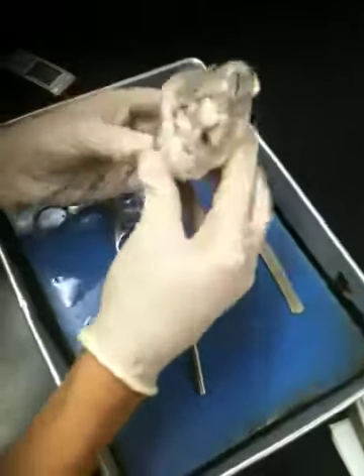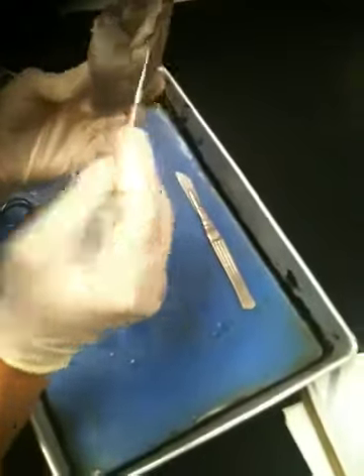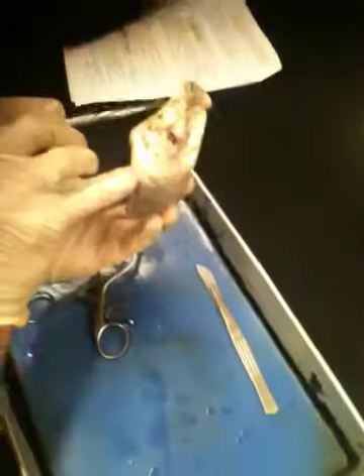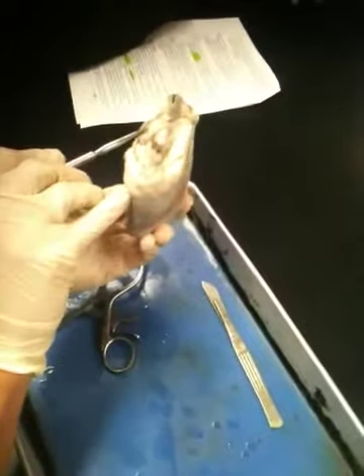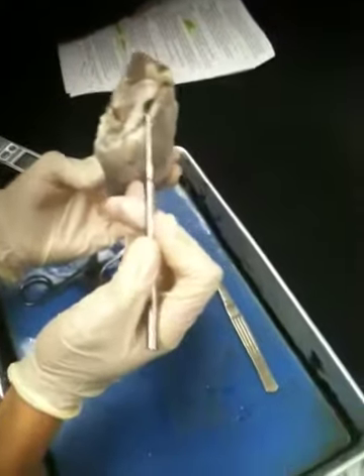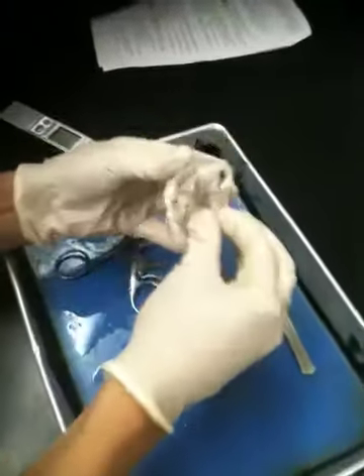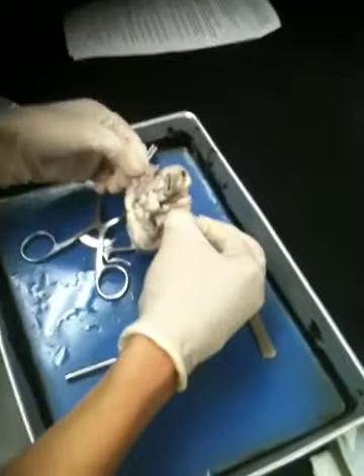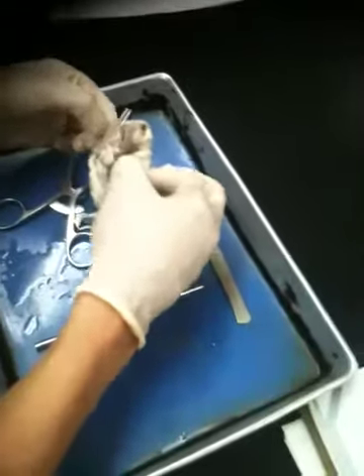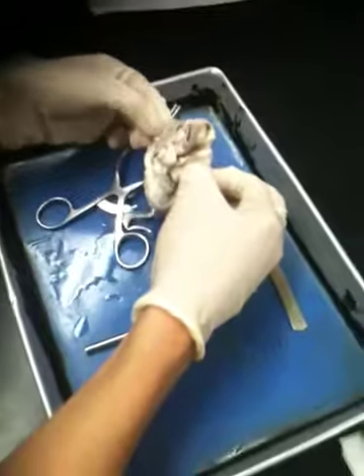All right. What if I were to hold the heart more upright and point out this small flap-like structure here or the similar one on the other side right here? That'd be a muscle. The auricles. These protrusions here and over here are those extensions of the atria, which are called auricles. It just so happens that they're a little bent out of shape from being in the bucket. So they're kind of like muscle flaps? Exactly, like little flaps of muscle, yes, because really the whole wall of the heart is muscle. So yes, they're just continuations of the chambers.